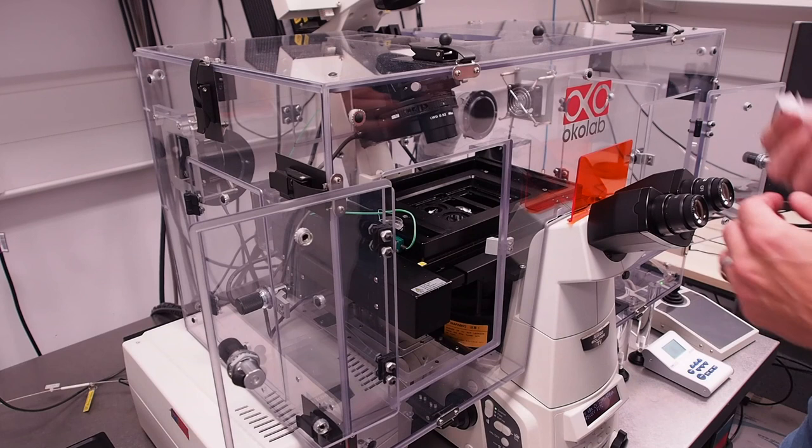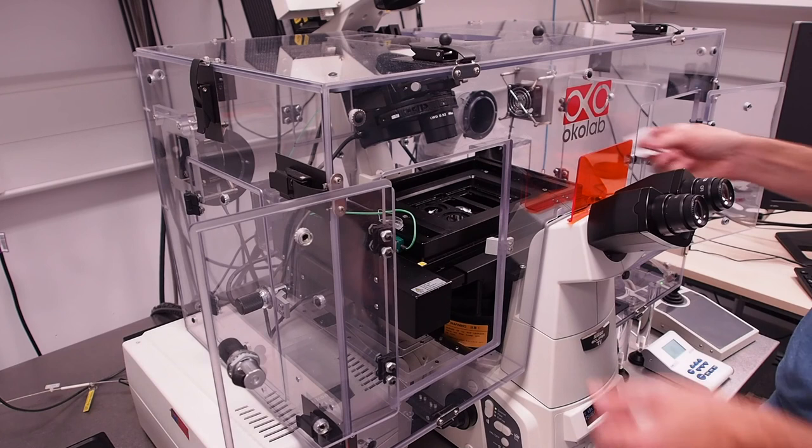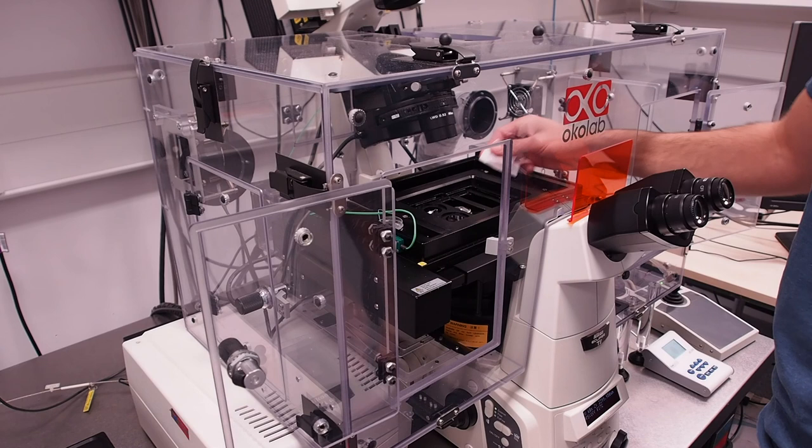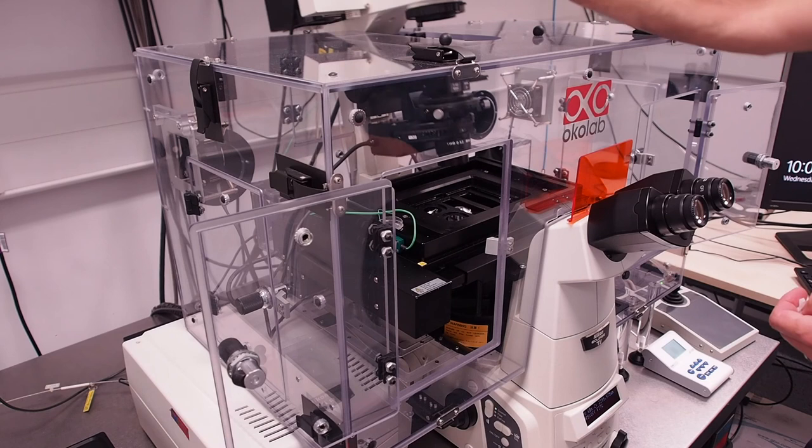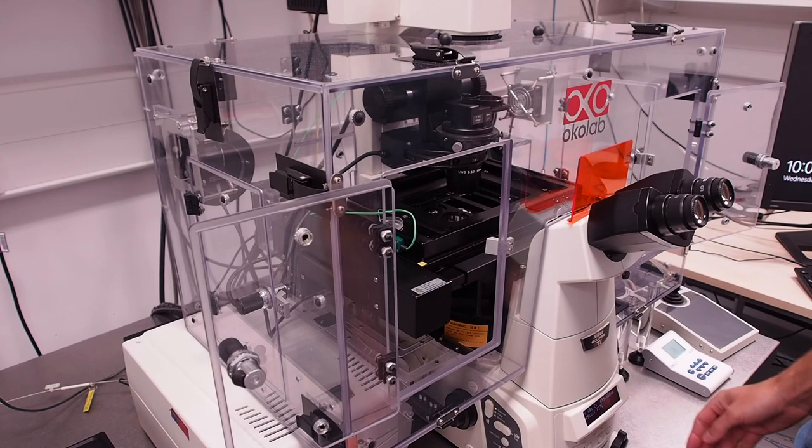Finally, take a clean, dry piece of lens tissue, fold it in half and wipe the lens to remove any alcohol residue. Lastly wipe any spillages from the microscope stage. Tilt the condenser arm forward again and press the escape button to move the objective down so that it is safe for the next user. Close the incubator doors and then begin powering off the machine.